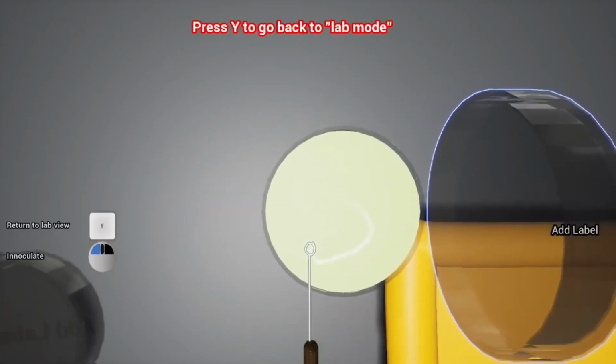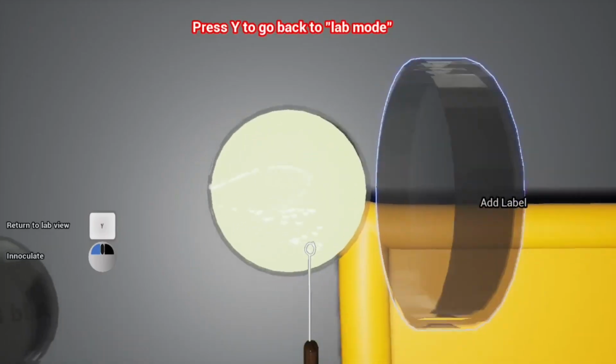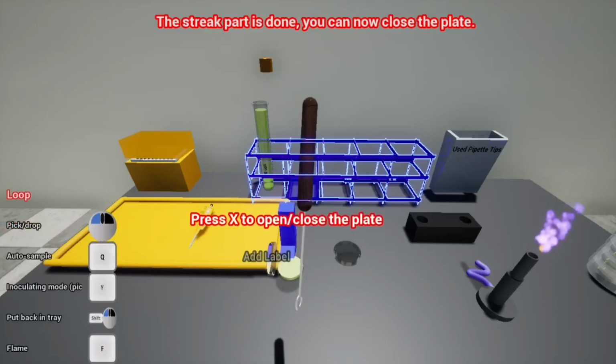Press Y or action wheel to go back to lab mode. So I'm gonna press Y to go back. Part is done. You can now close the plate.